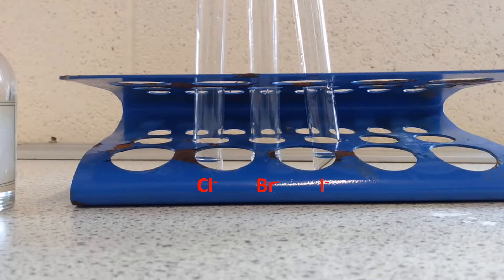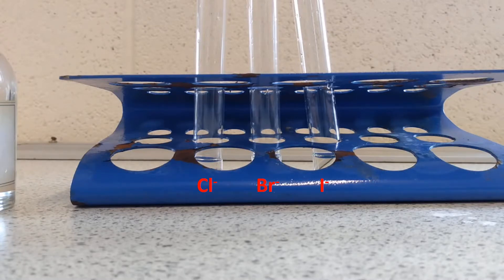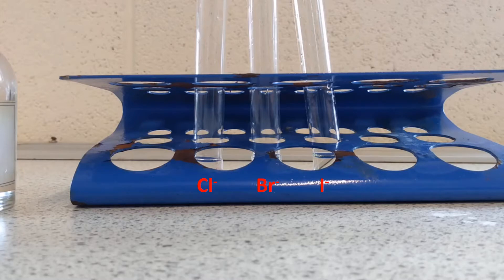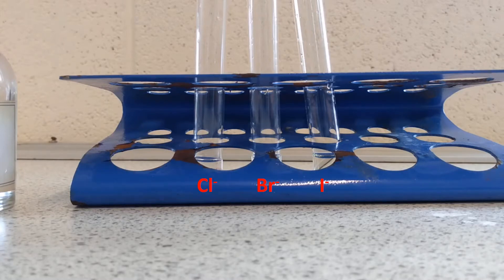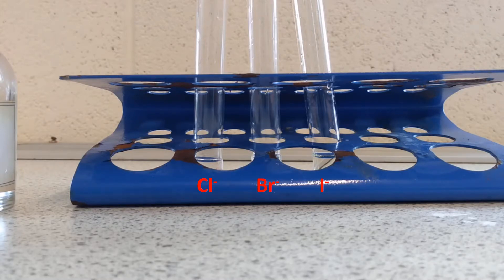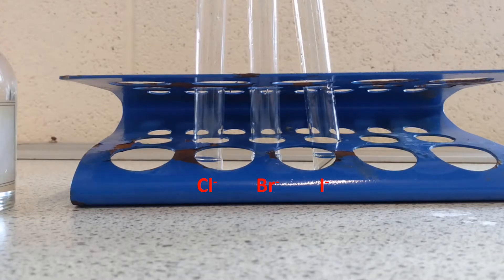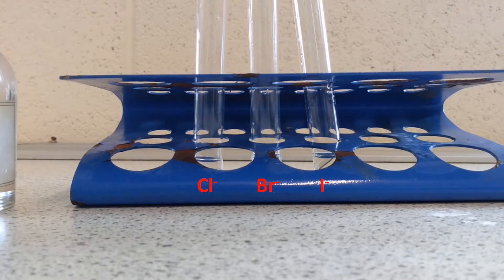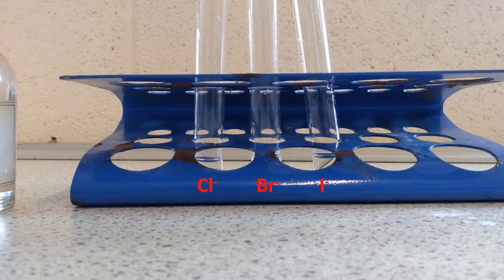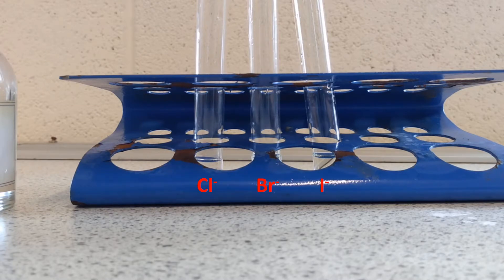For this next test I'm testing for halide ions — remember that halides are ions produced from elements in group seven. So here we're looking at chloride ions, bromide ions and iodide ions. We can't use this test for fluoride ions because the test makes a silver halide precipitate, and silver fluoride is actually soluble, so it doesn't make a precipitate.